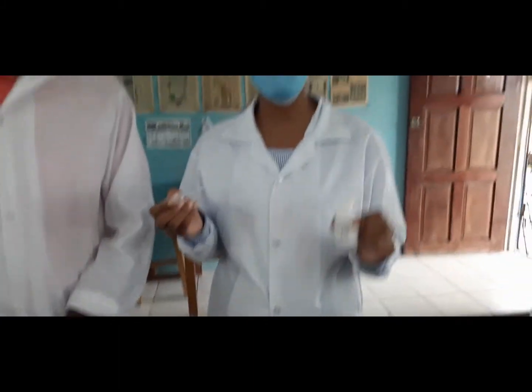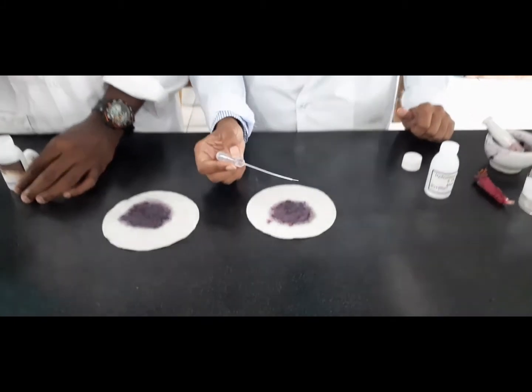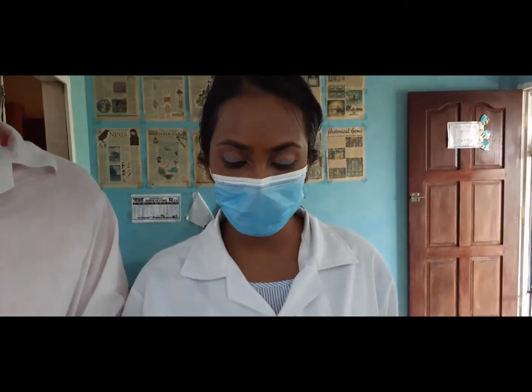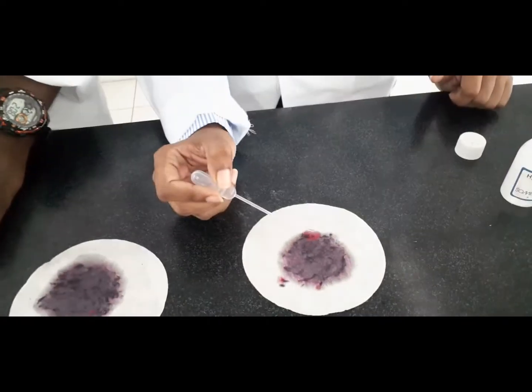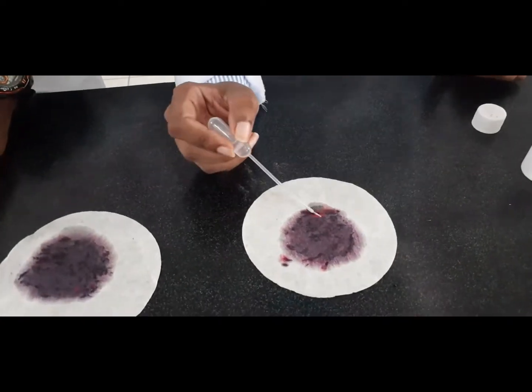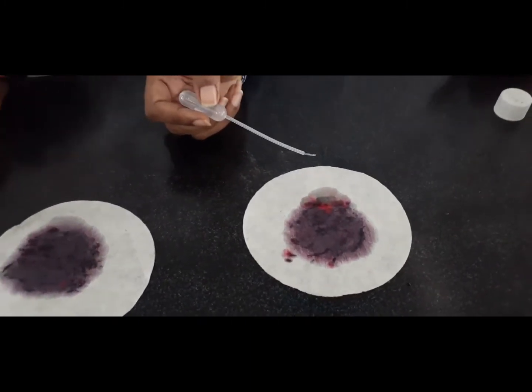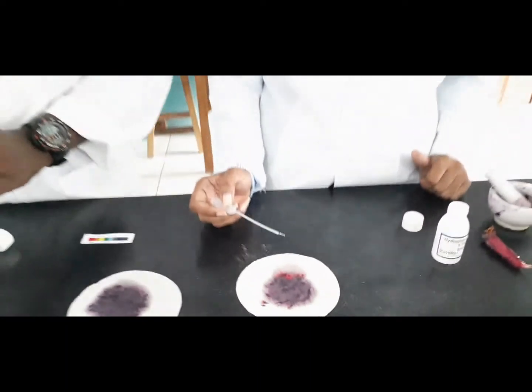First we'll be using the acid. So let's see what color we would have when we apply the acid to the indicator. So in the case of having an unknown solution, we will know when it turns this color that it is an acid. So we have here the color red. So when a chemical is added to our indicator and it turns red, we will know that it is an acid.